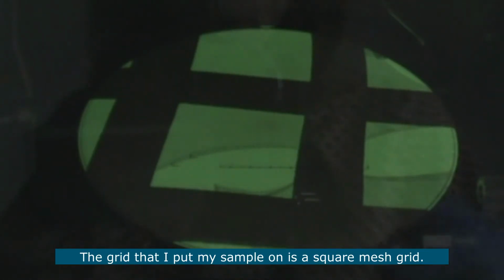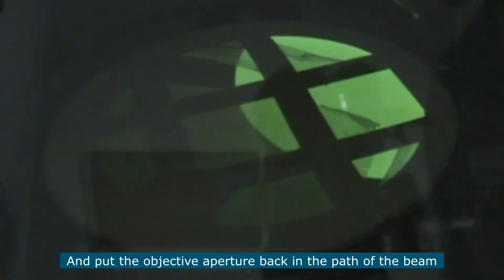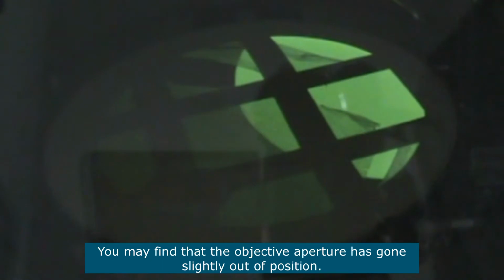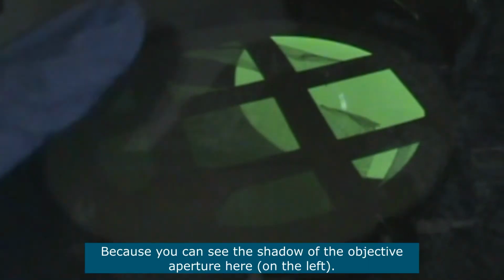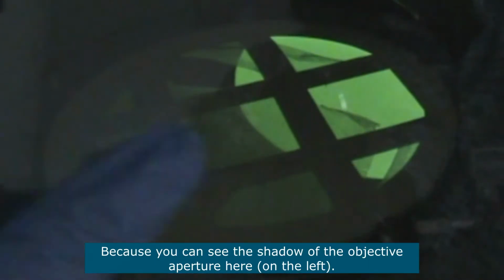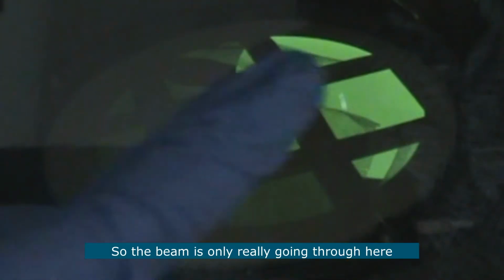The grid that I use to put my sample on is a square mesh grid, and what you're seeing, these black lines, are actually the metal lines of the mesh on the grid. When you are the first user of the day and you've switched the filament on and you've placed the objective aperture back in the path of the beam, you may find that the objective aperture has gone slightly out of position. You can see that clearly in this image here, because you can see the shadow of the objective aperture here. So the beam is only really going through here.